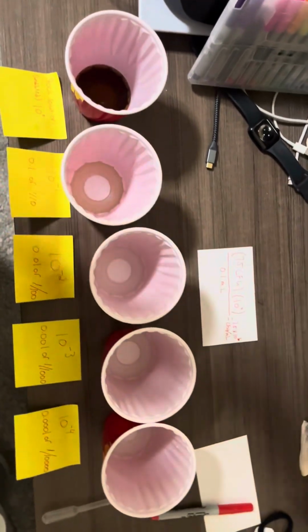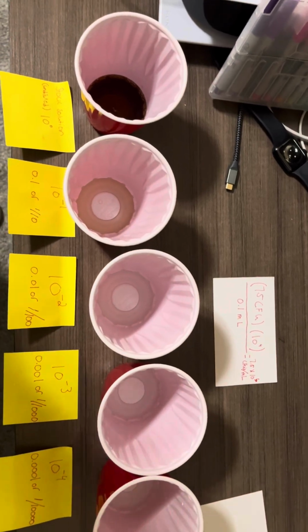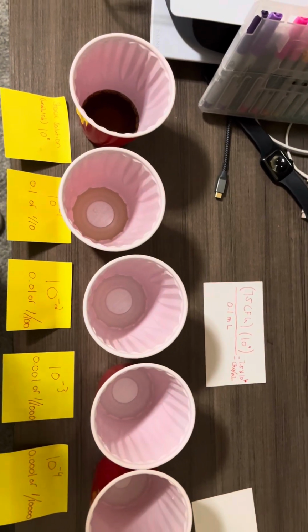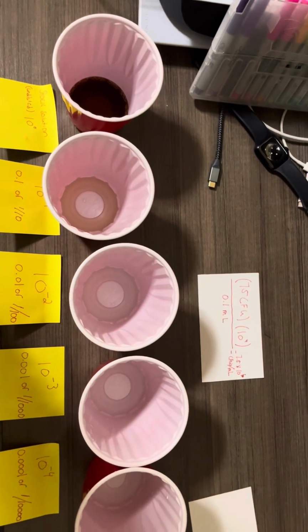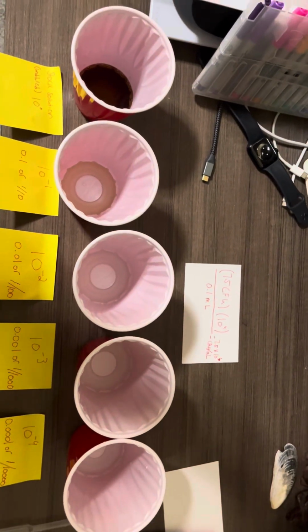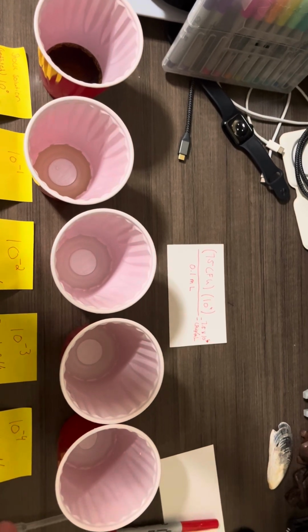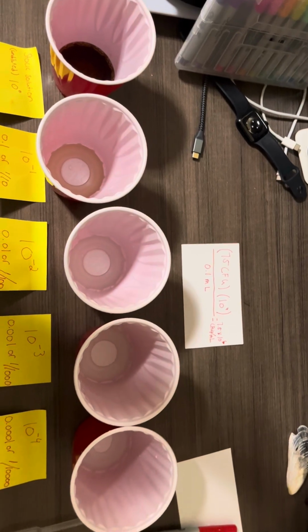Now, an important thing to note when you are performing this lab is that you're abiding by all of your safety protocols, as you will most likely be using a bacteria that is harmful, something probably in fecal matter. So it's very important that you exchange your pipette tips, or in this case, your reusable pipette, between each dilution.